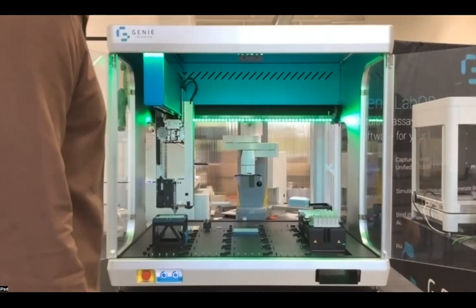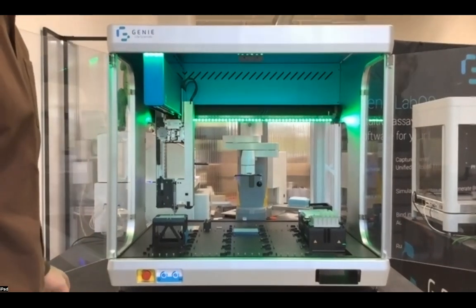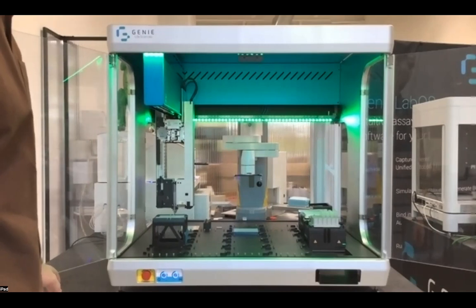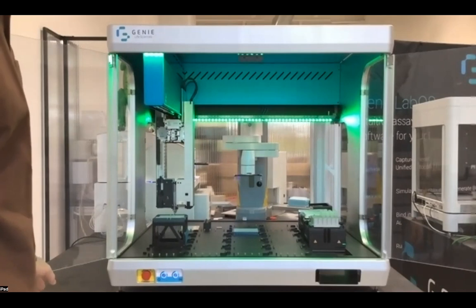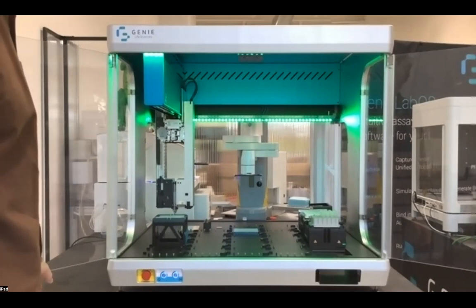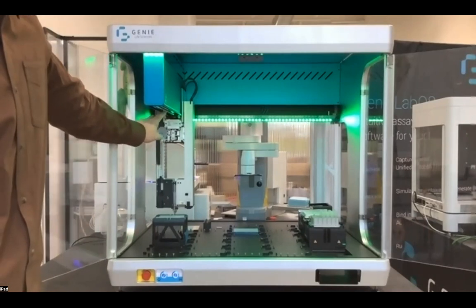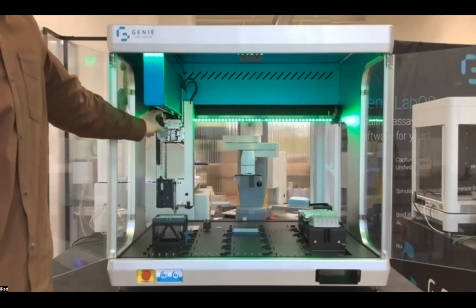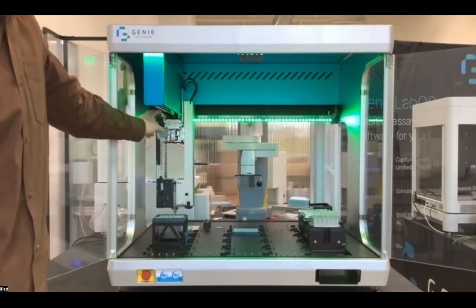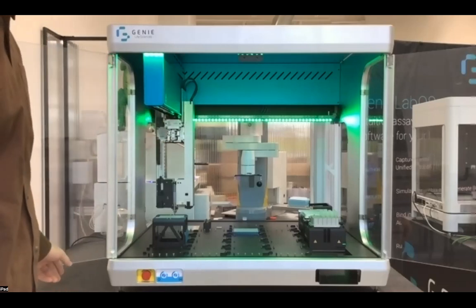With that, you have the ability to detect liquids that are going to be very difficult to detect with capacitance-based liquid level detection. And you also have the ability with this head to very easily remove it with this golden latch up here. And this can be done anytime, even at runtime, so that the instrument is going to have as little downtime as possible.